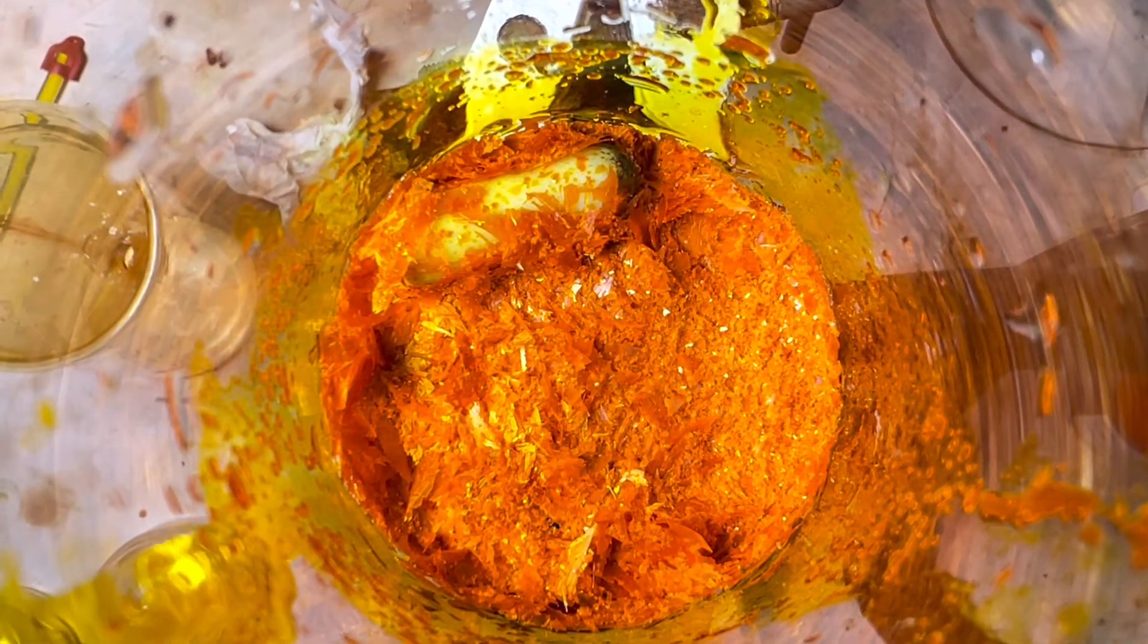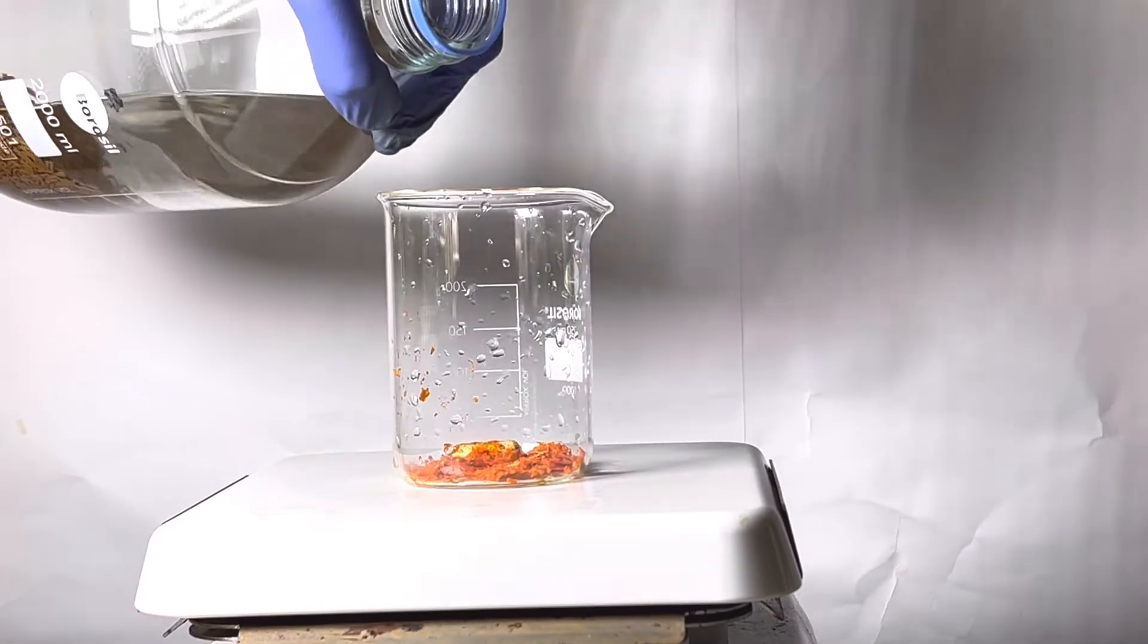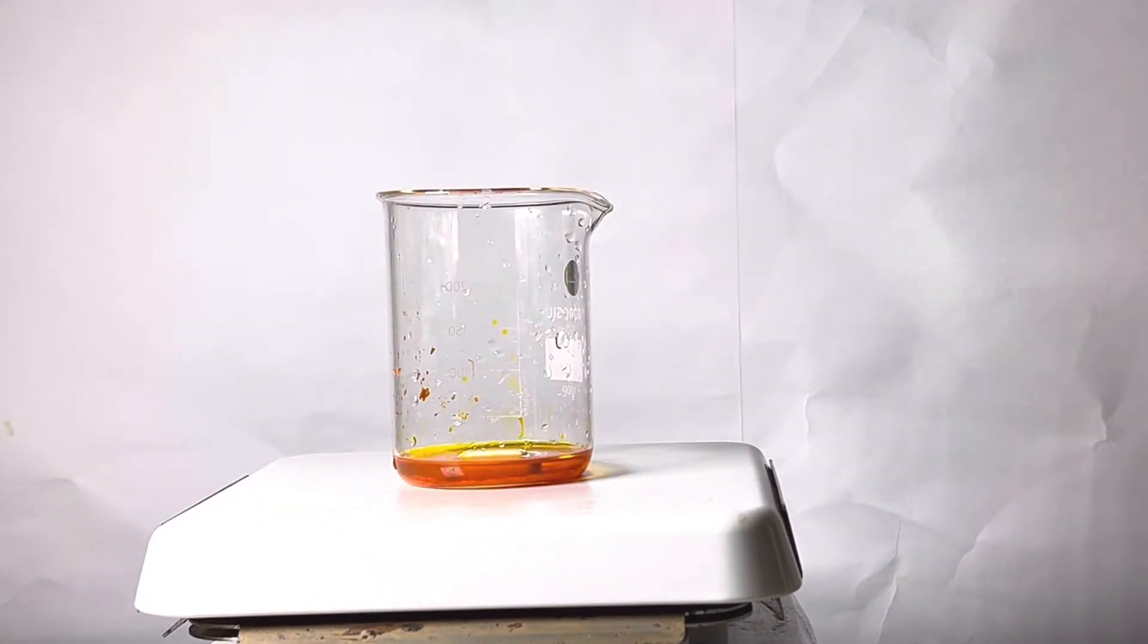This is the crude product after drying. The product was recrystallized from 96% ethanol.